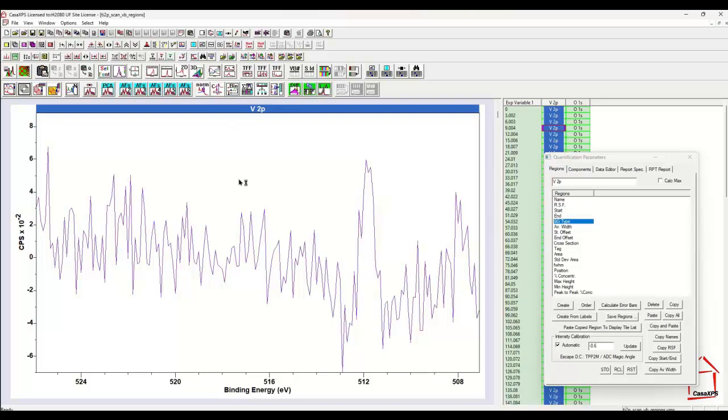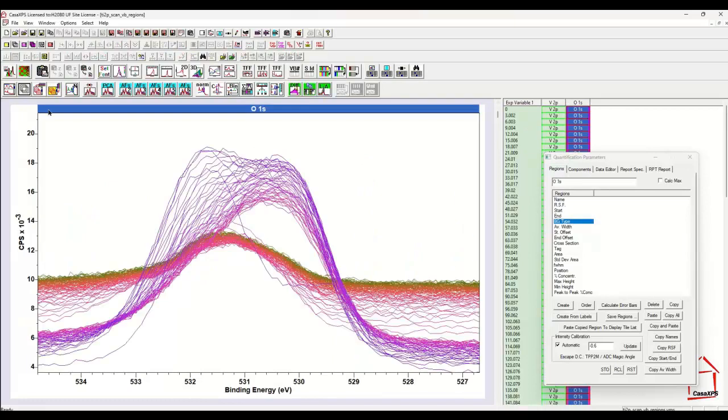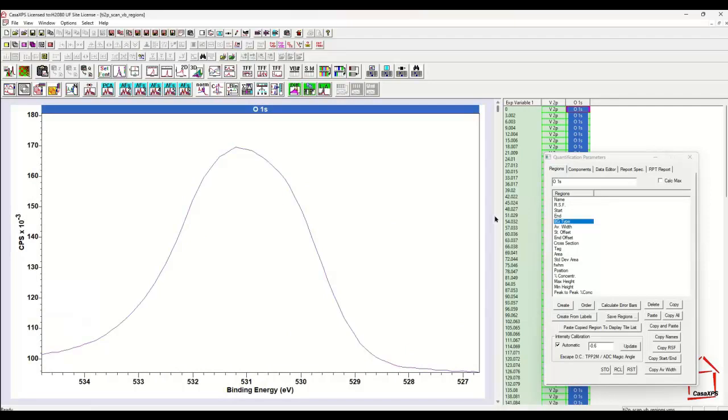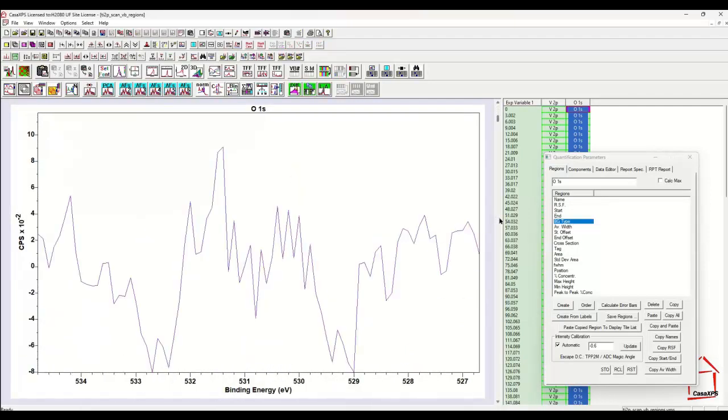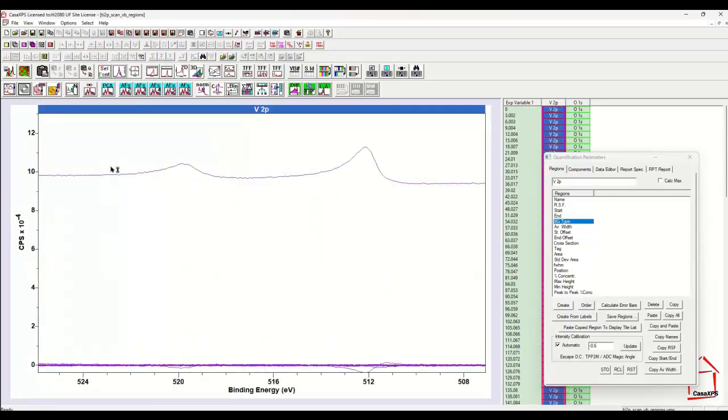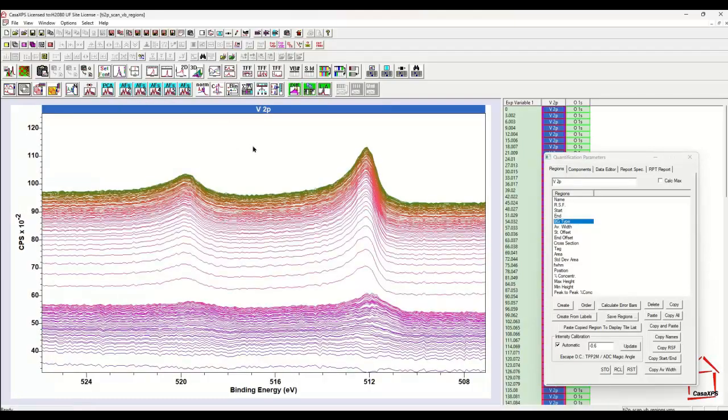So this means I can perform PCA on the vanadium alone and not have to include the variation that would be associated with the oxygen. So PCA applied to the oxygen, how many do we have in this case? 1, 2, 3, 4, 5, 6, 7, 6. So we've split the variation between the oxygen and the vanadium, and therefore the PCA can apply the decomposition to just vanadium or just oxygen, and therefore we don't get so many abstract factors that are significant for the data that is actually noisy. So let's reconstruct these vanadium with 3 abstract factors.